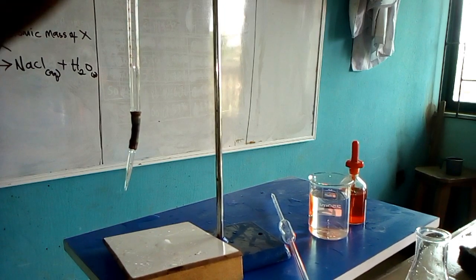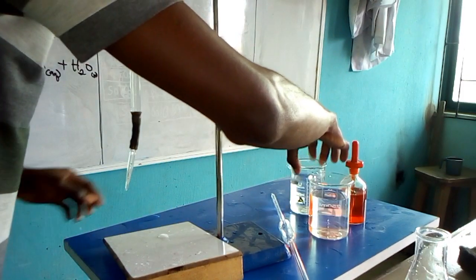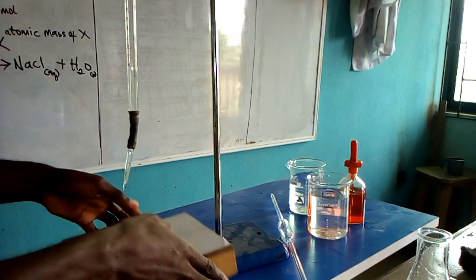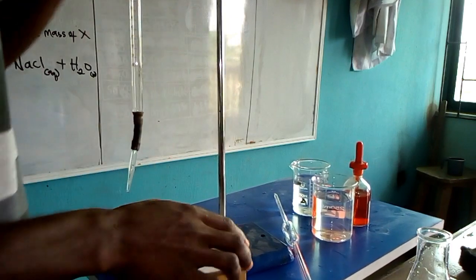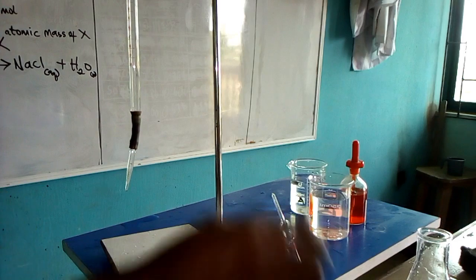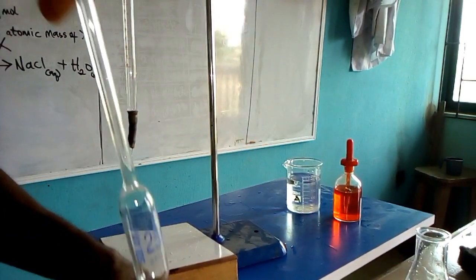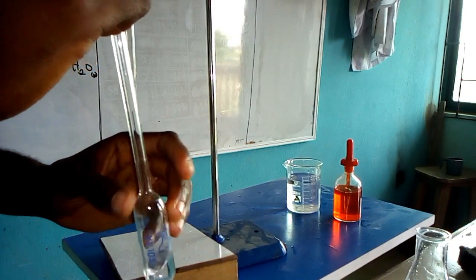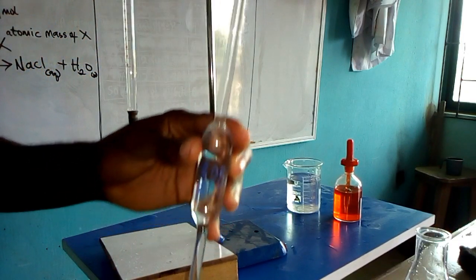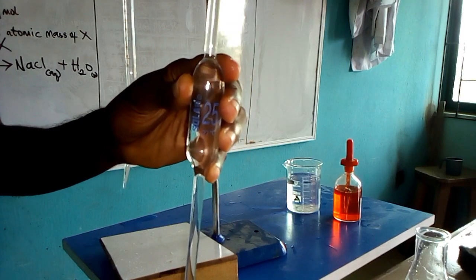Fill the burette to the zero mark. Read at the lower meniscus to confirm it is exactly zero. Then measure out the base using the pipette until it reaches the 25 cm³ mark.